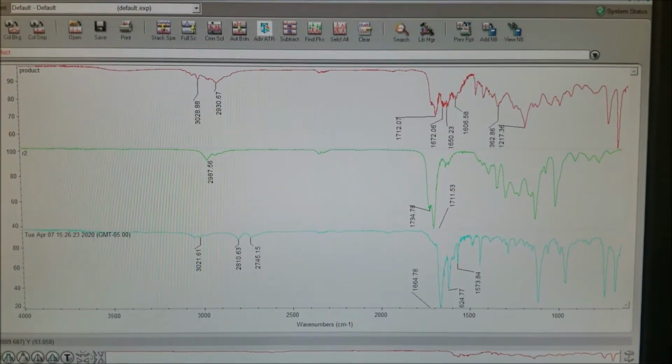At this point, I ran an IR of both starting materials, which are trans-cinnamaldehyde and ethyl acetoacetate, and my product. This way we can compare the three. Please note in this spectra, the red spectra is my product, while the other two are my reagents. Okay, let's see how well this looks.